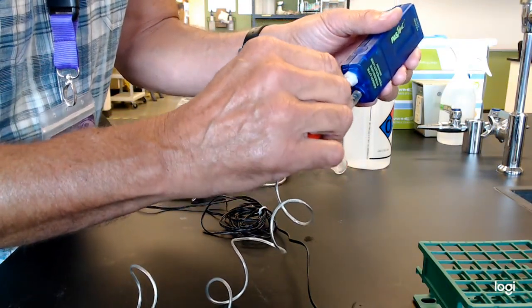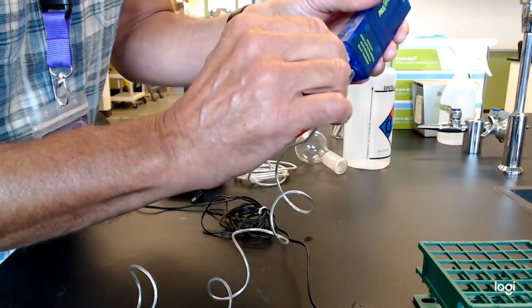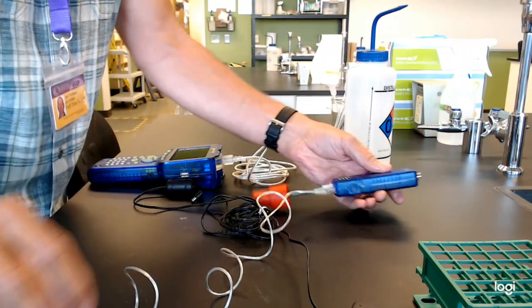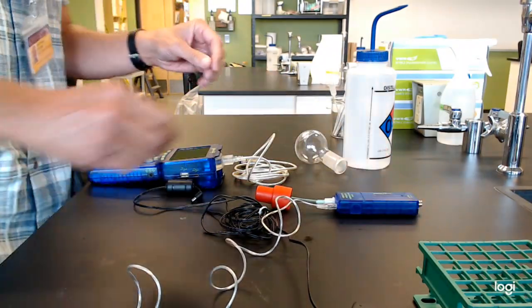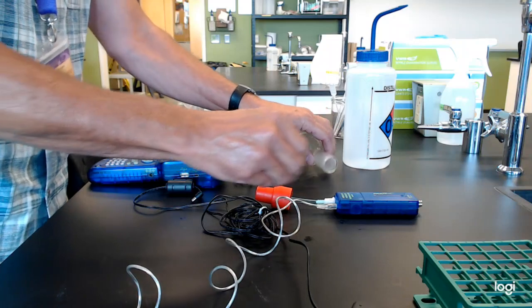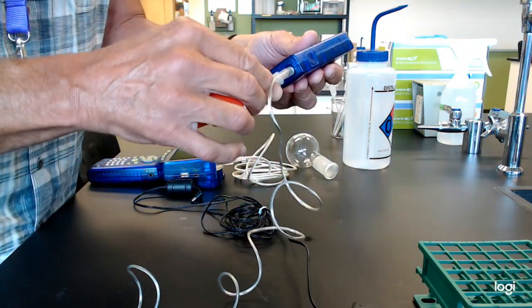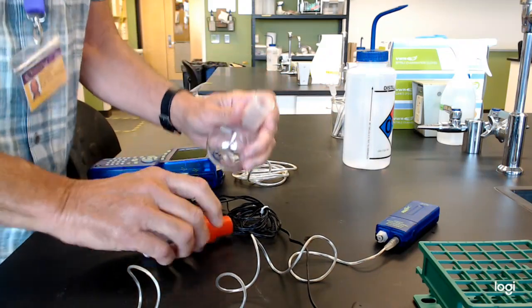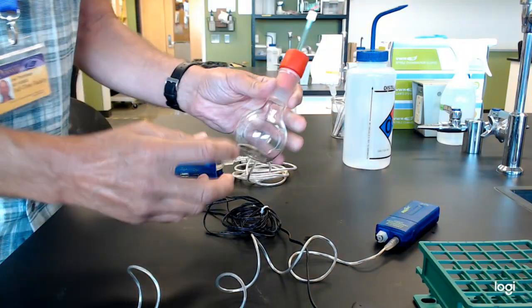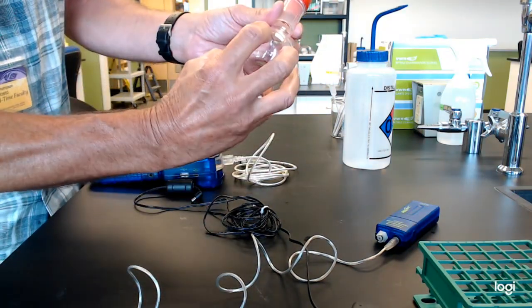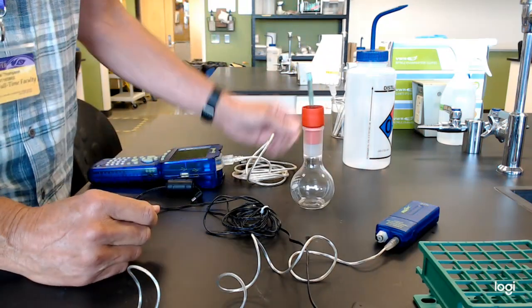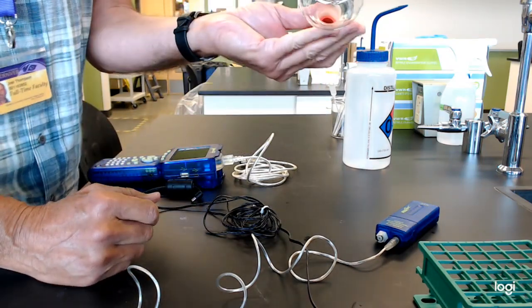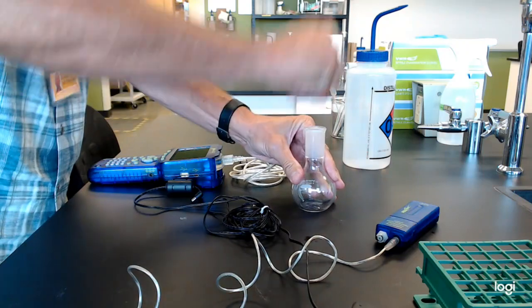So now you have your pressure reader actually on. I hear it click. For this particular lab, I'm going to unclick it for a minute just so you can see the setup. We're going to do vapor pressure in the headspace above a liquid that's inside this round-bottom flask, which happens to have a flat bottom, but it's helpful for standing up.